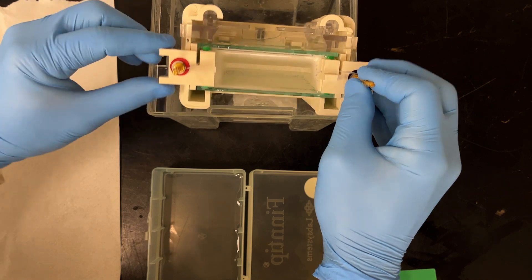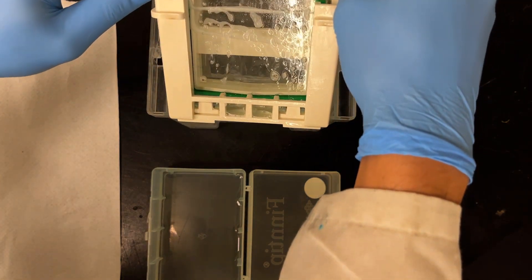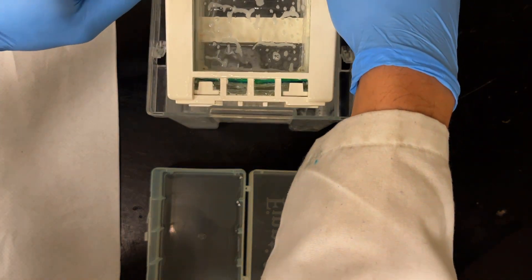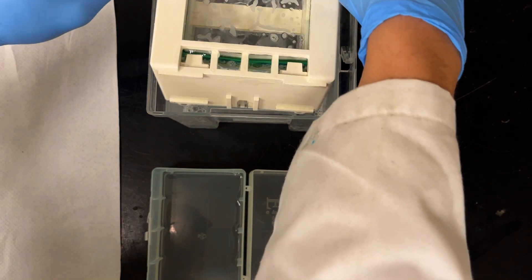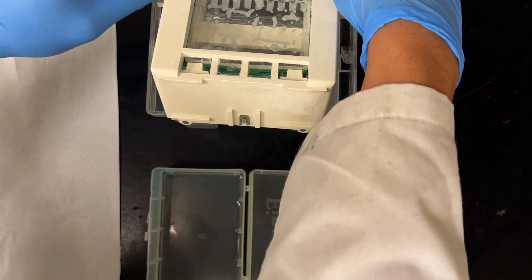So there is that little dot I made, right? Just to show you gel one. I wanted to show you once again how we take apart a gel and then ultimately we're going to go and stain it.